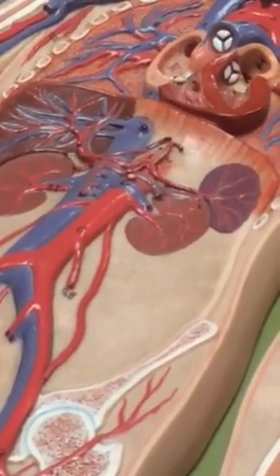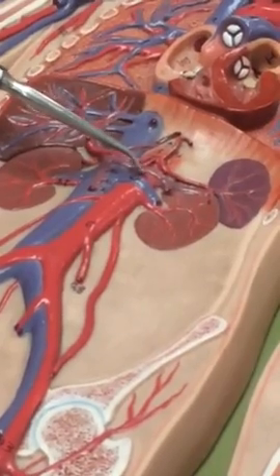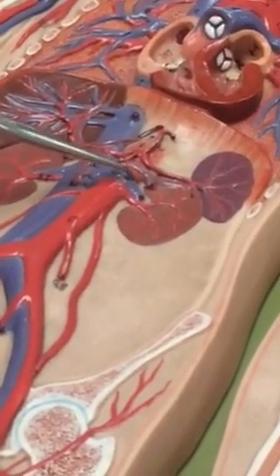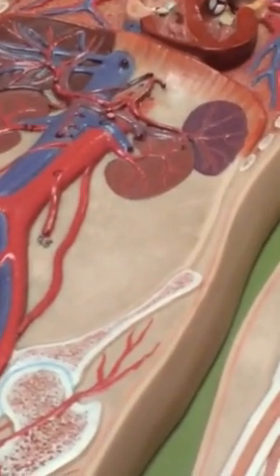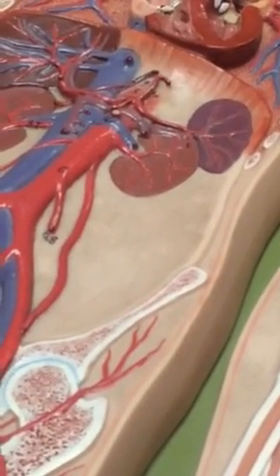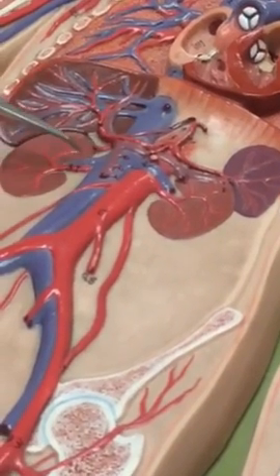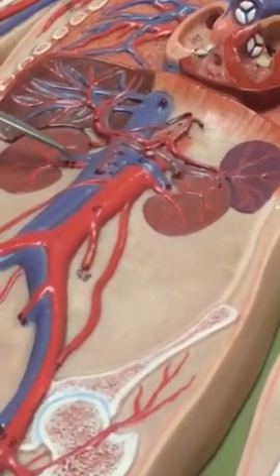Superior mesenteric artery. Right there, coming up out of the aorta by itself. And it's always over top of this left renal vein. Always comes out right on top. And then the renal arteries. So your left is the red under there, and the right's over here, little red guy.